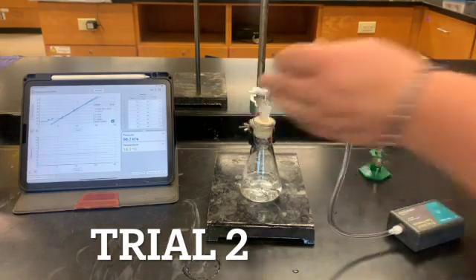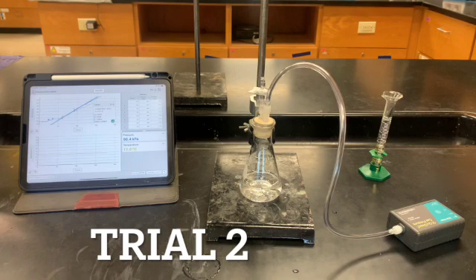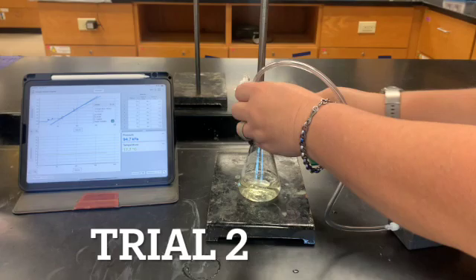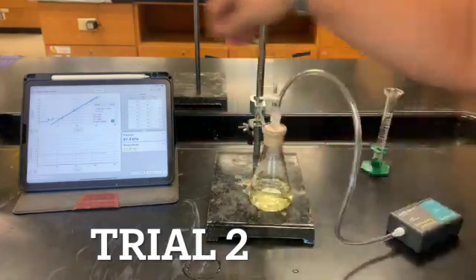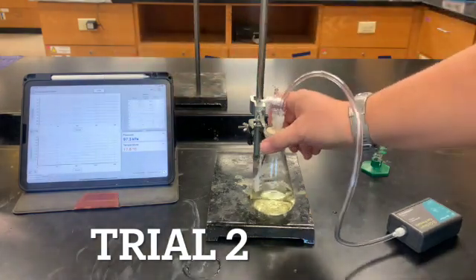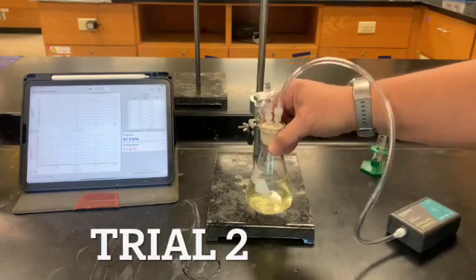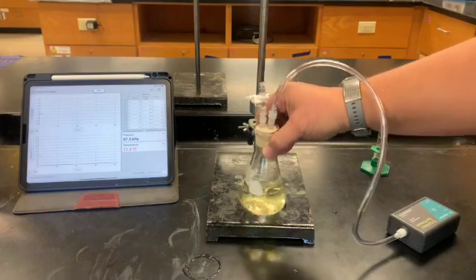gas probe. Everything's working right. And we're going to dump the KI into it, and we're going to press collect and let it go for 3 minutes. So here we go. Make sure it seals real well. And collect. This will work better when you have your partner. Okay, we're gonna let that one go forward and we'll see what we get for our results.